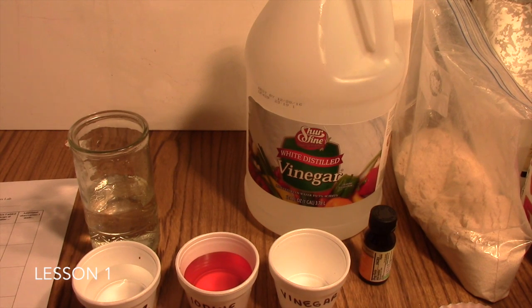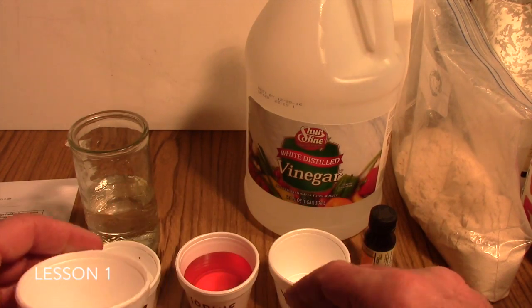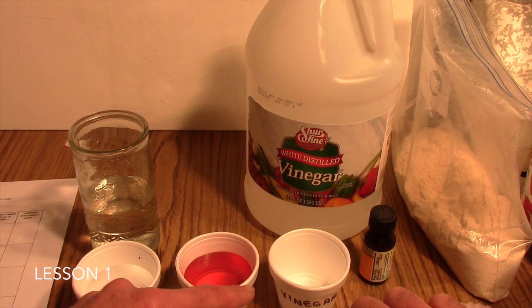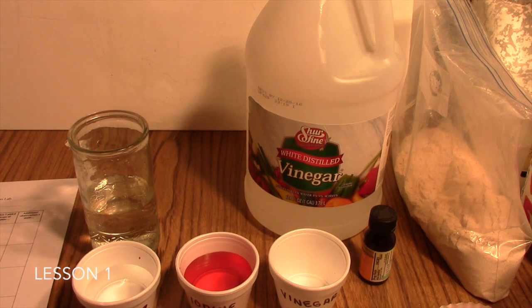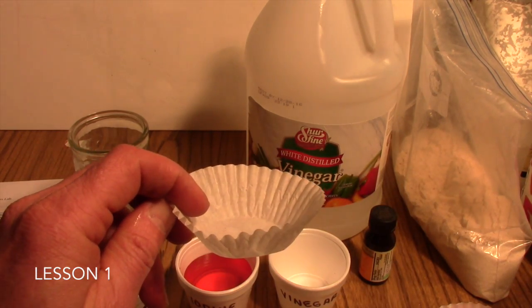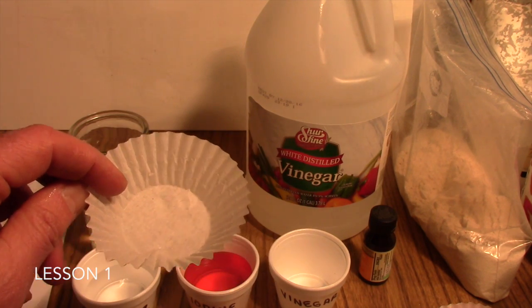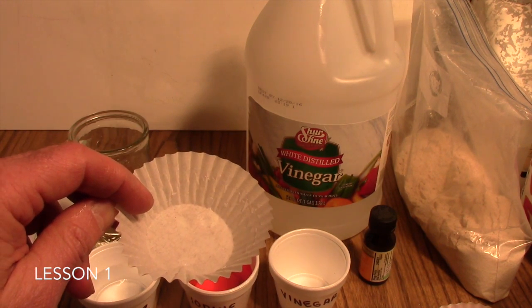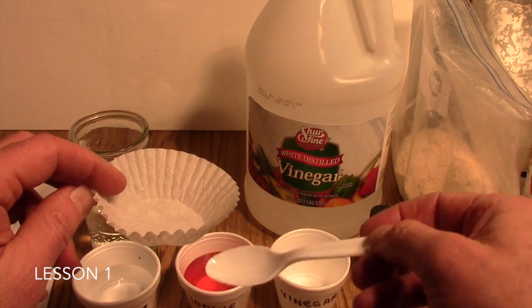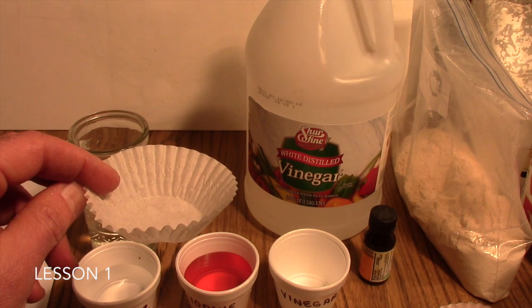So, because you don't want to contaminate your samples of your powders, what you'll have your students do then, and there's different ways to go about this. We found that just using cupcake liners, these waxed cupcake liners, work pretty nice for the students then to transfer some of the white powder sample into these at their desk or at their table.